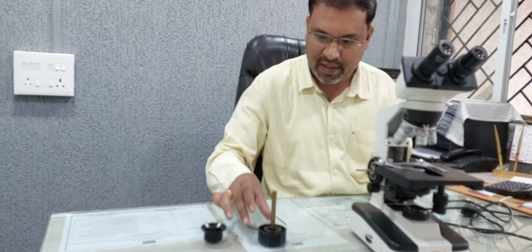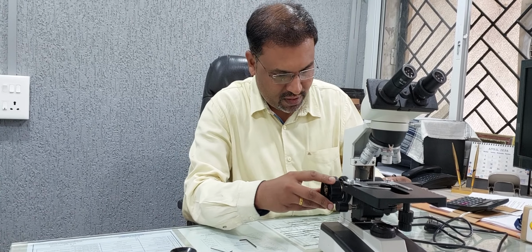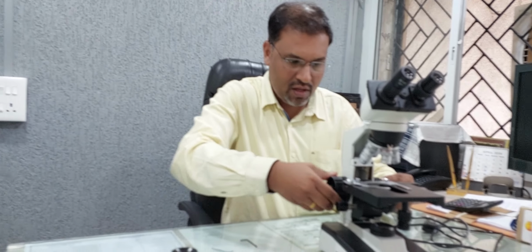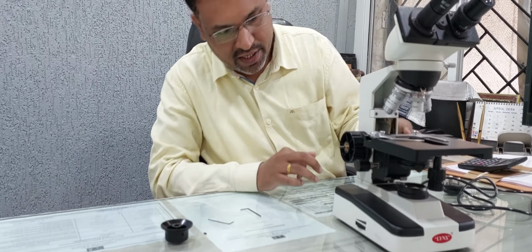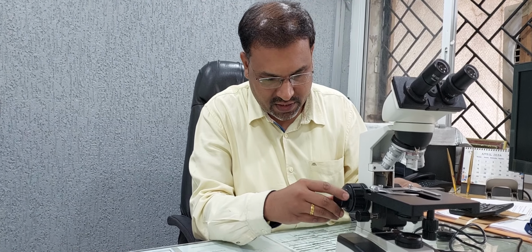This is the Allen key. After that, just insert it and try to rotate it in the proper way. At the time of fixing, check the position of the washer. If it gets displaced, it will not be fixed properly. And at the last, you have to do the fine adjustment knob. This is the fine adjustment knob.